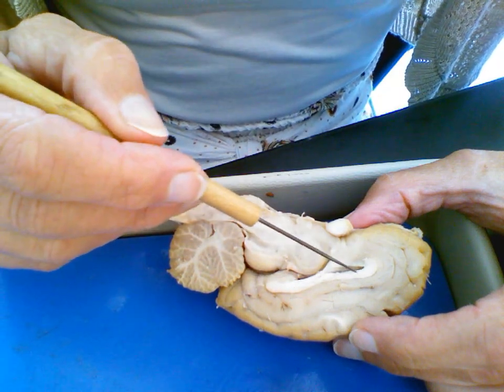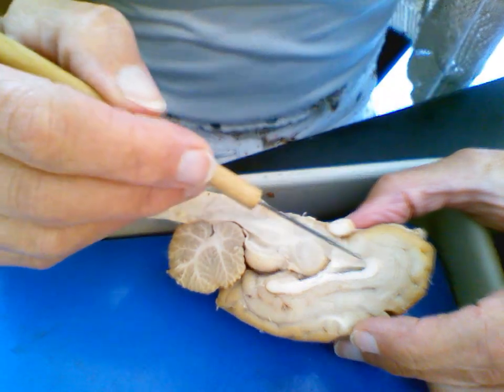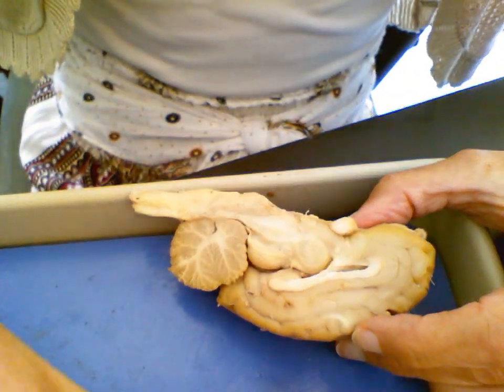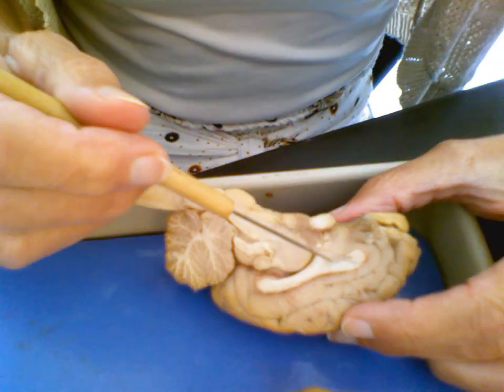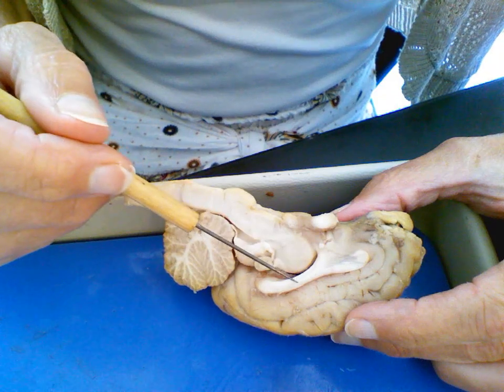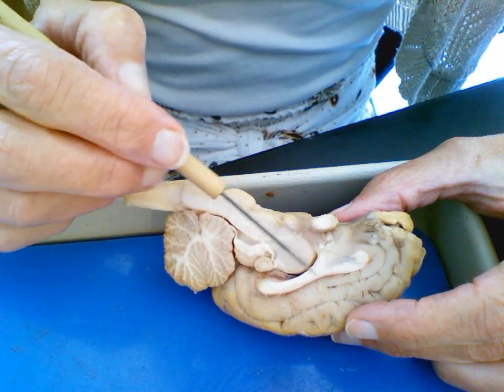Normally this lateral ventricle has a little film over the top of it, a little bit of a division. I'm going to switch again to this one, because here you can see it's still intact. So it doesn't look like an open structure. It's because there's a little septum, a tissue-like structure that separates it.